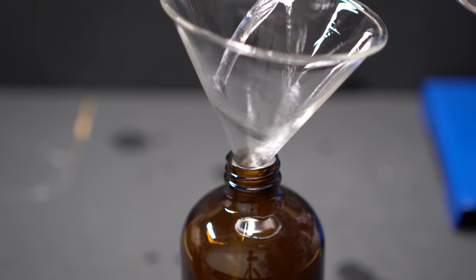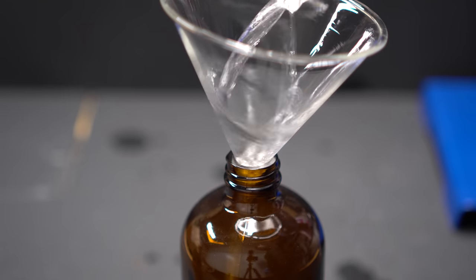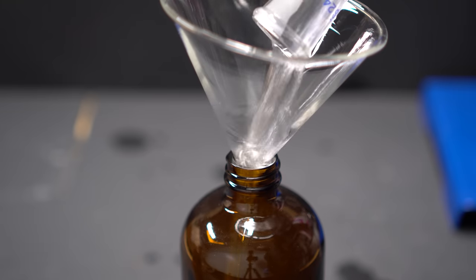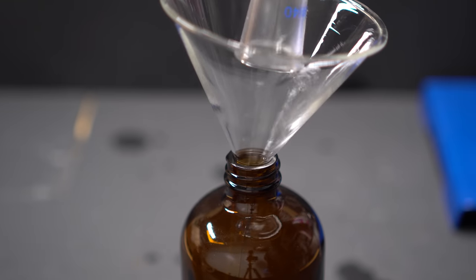There's no point to really say how much I got as there's a huge range in the ether content and the heptane content. This is a really good way to get heptane and diethyl ether as it's pretty cheap to get the starting fluid, only about three dollars at your local Walmart.